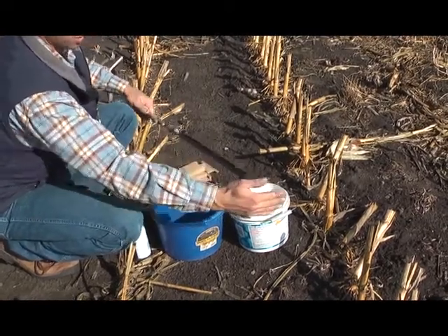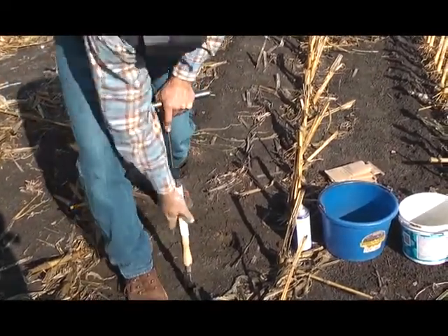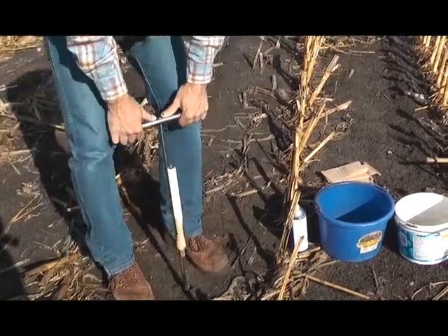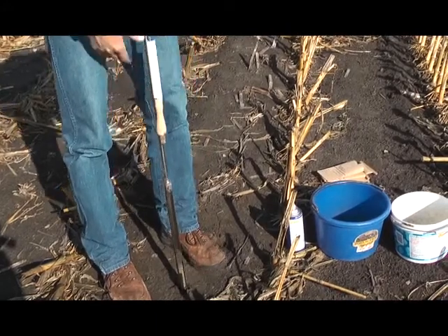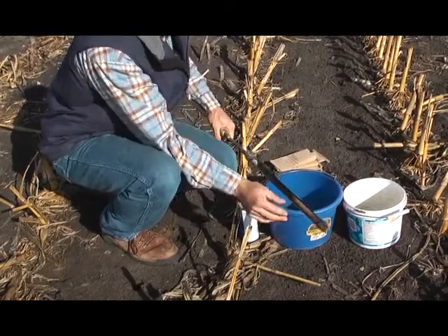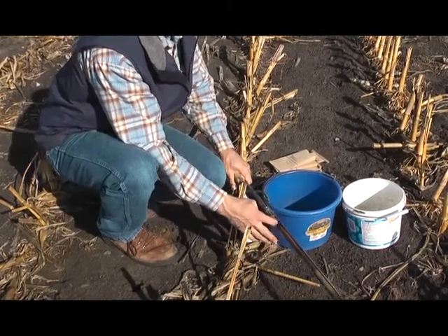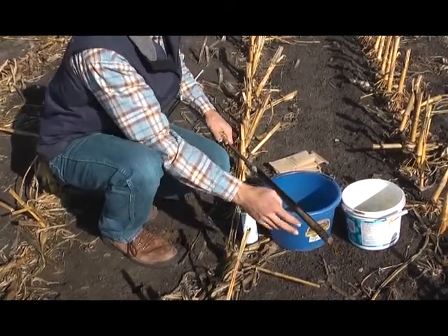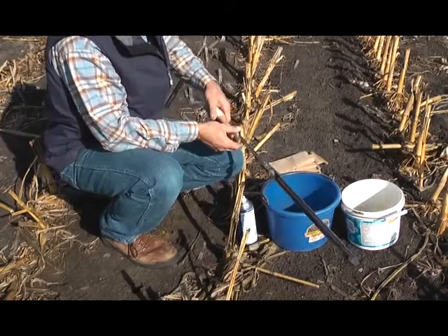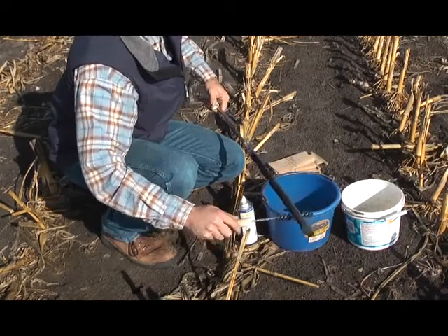The six to 24 inches will go in the other bucket. Now my probe isn't 24 inches long, so I need to go down the same spot again to get the rest of my sample. I scrape off that top soil and clean that off — that was just a little bit of dirt that did fall into the hole, and I can easily see that from the different color of the soil. That will make up the rest of my sample. If I do have any dirt left in here, I will clean it with this cleaning brush and get ready for the next sample.